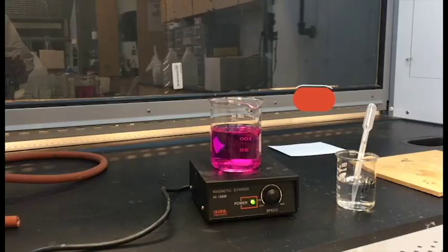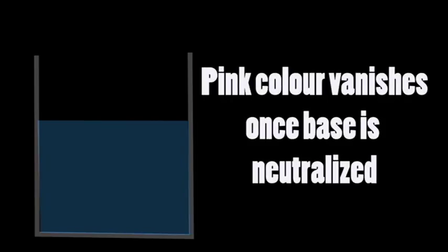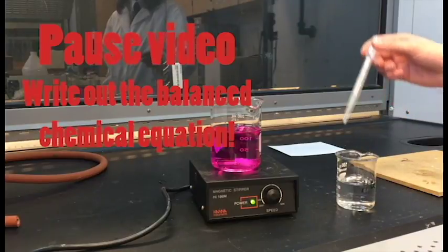Here we have hydrochloric acid and sodium hydroxide. We're going to slowly add the acid, which will react with the base to produce water and a salt. This is a neutralization reaction, and when the solution is completely neutralized, we should see the pinkish color caused by the phenolphthalein vanish because the solution is now no longer basic.